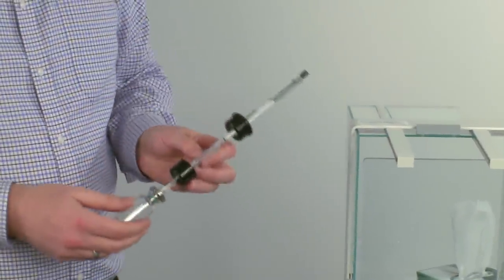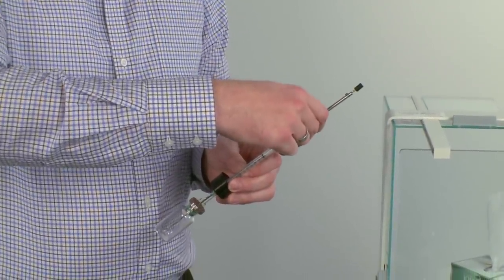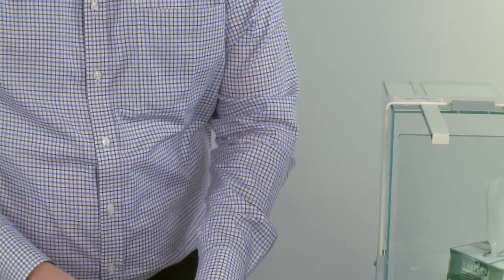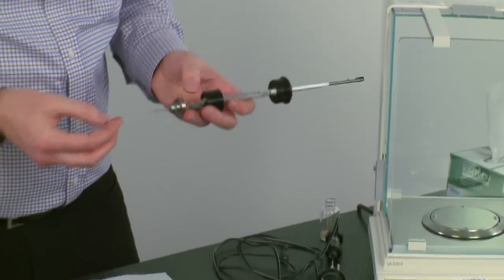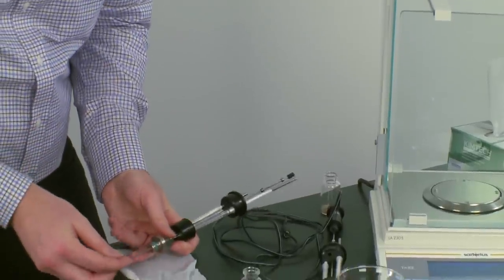Next, remove the plunger even further, pulling air inside the syringe. After removing the ampoule, place the plastic stirrer on the central shaft.